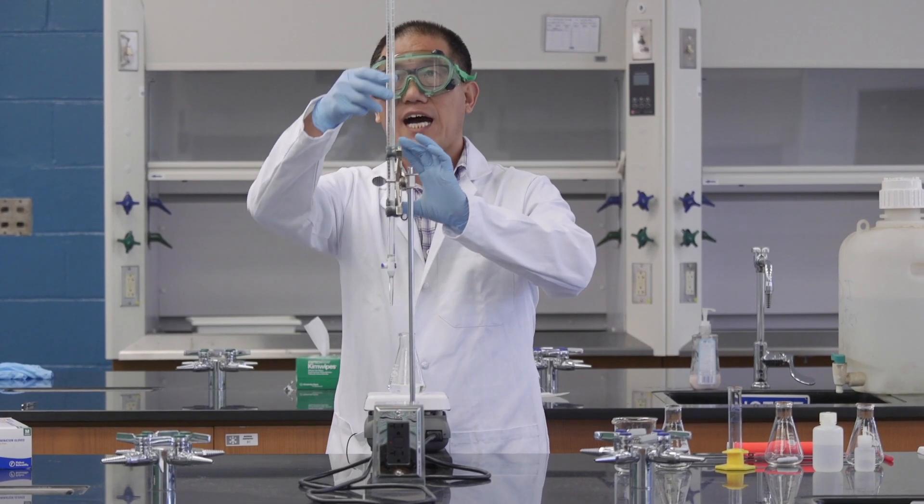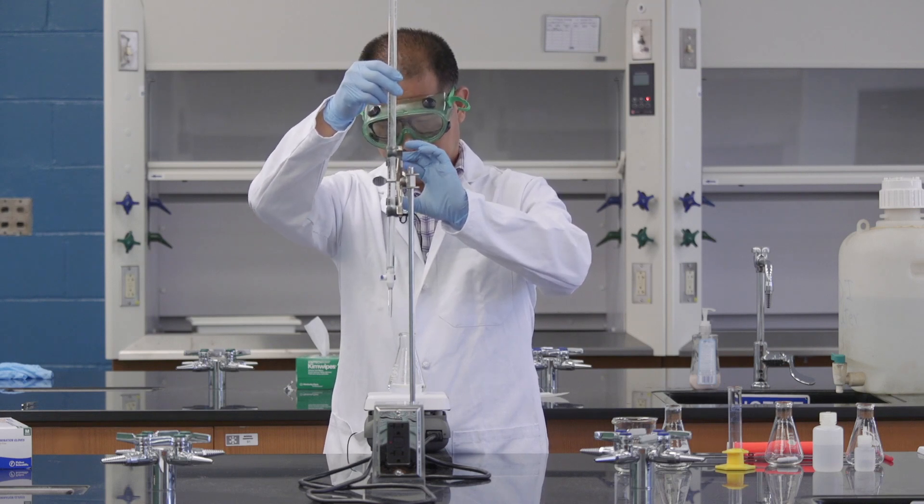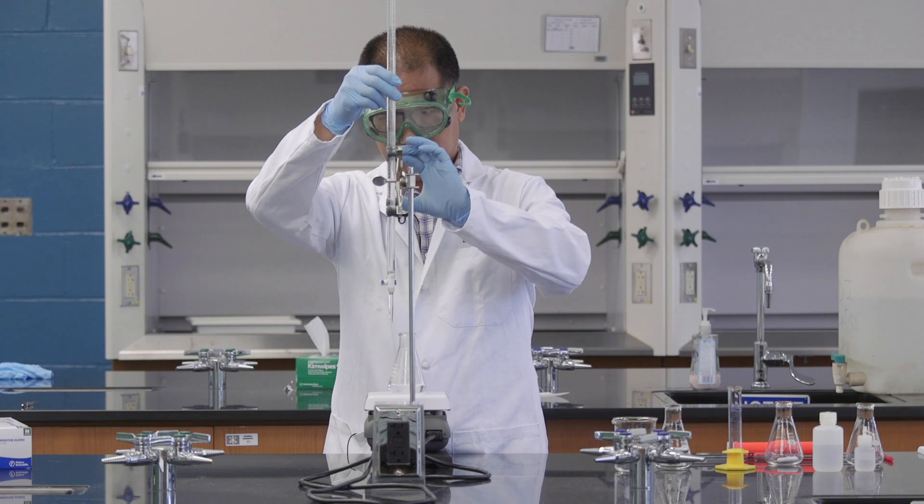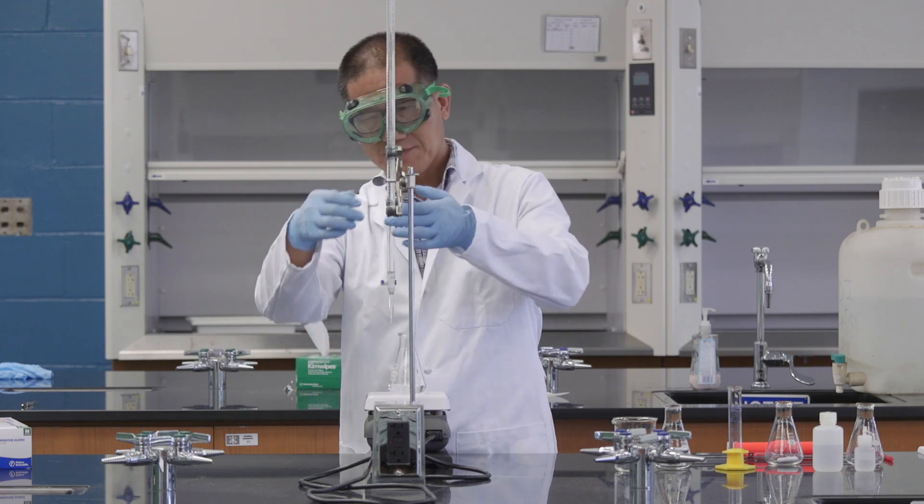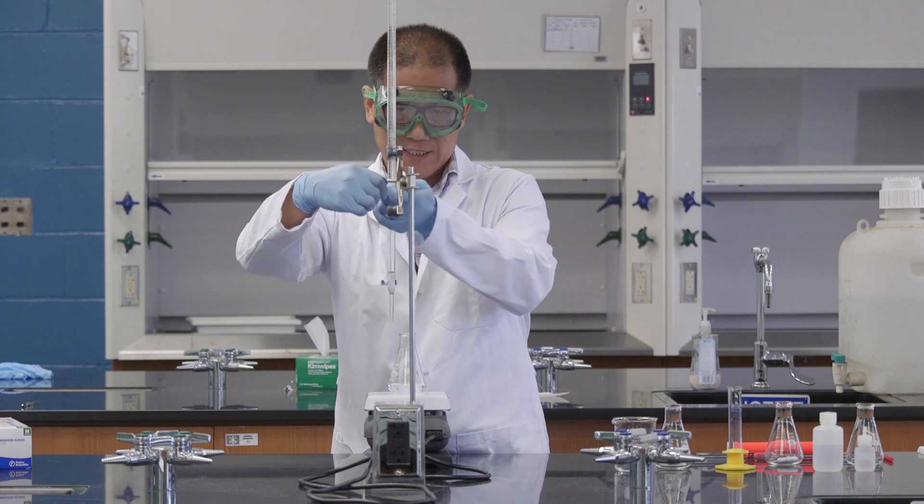Now I'm going to adjust the height of the burette again. It seems I have adjusted the direction of this clamp.